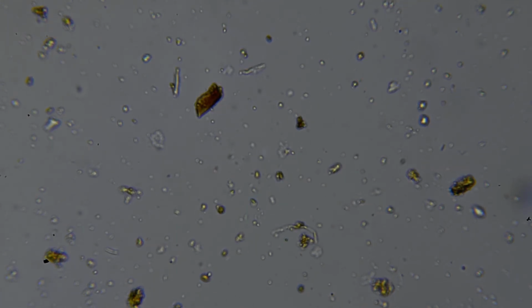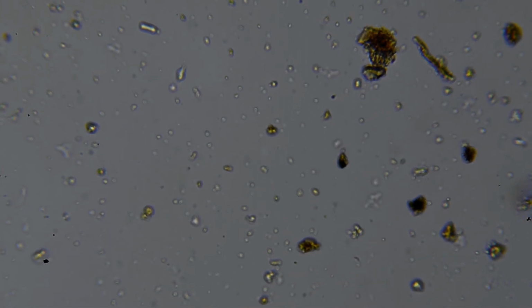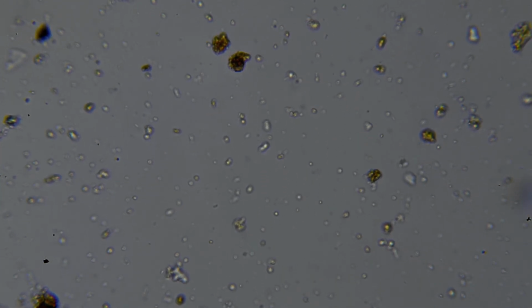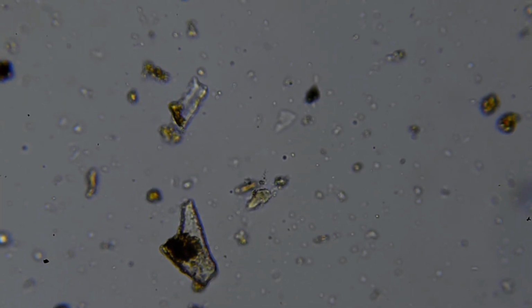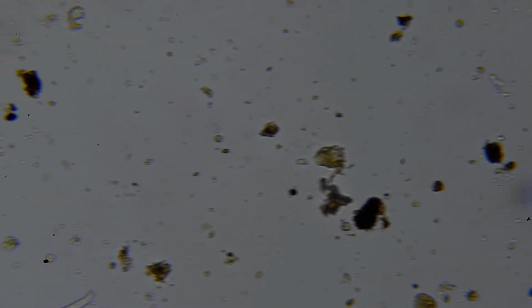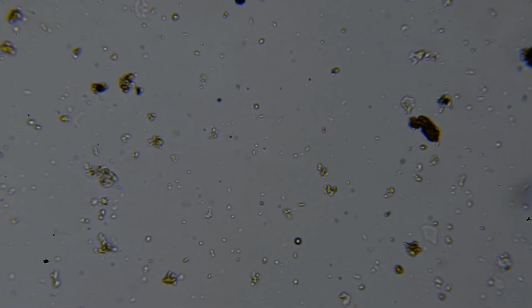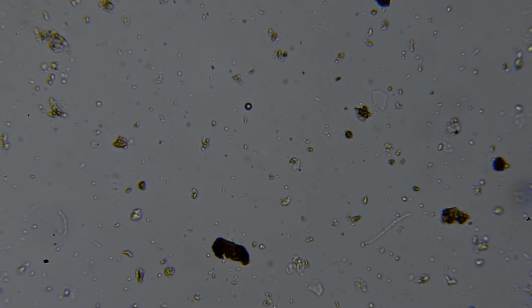So lots of bacteria, as I would expect. This is all pretty much as I would expect it to be. Very bacterially dominated. The other thing that we're looking for are cysts. Basically, when predators have gone dormant, when the conditions don't favour them, they can create cysts, which allows them to survive the bad times. So that little round ball there, right in the centre.